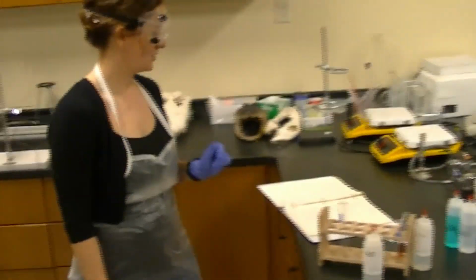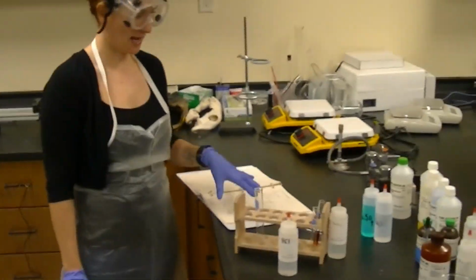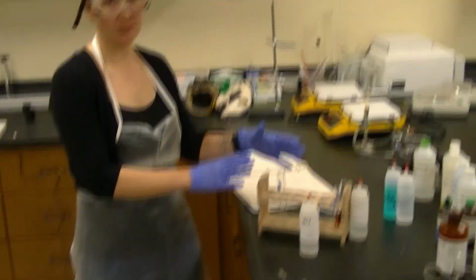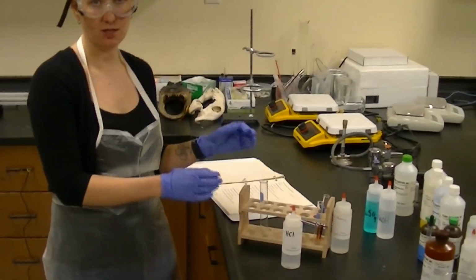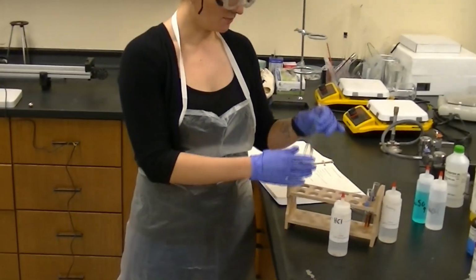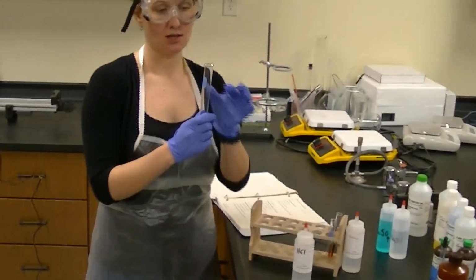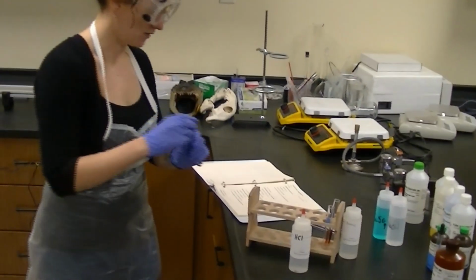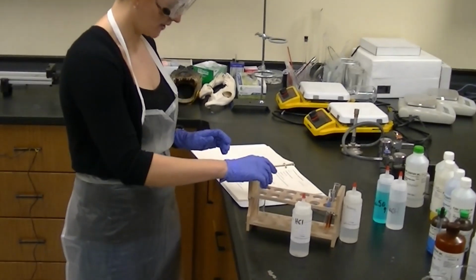All right, so today we're doing Lab 9, the Chemical Reactions Lab. So I'm going to go through these. I'm going to show you the appearance of each reagent that we are using so that you can record your observations there. And then I will show you, after I mix those two reagents, what the reaction itself looks like so you can record those observations as well. So let's start with the first reaction.